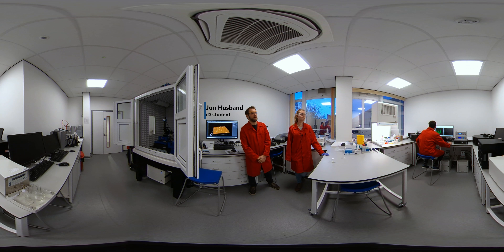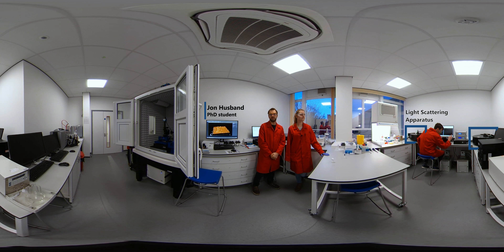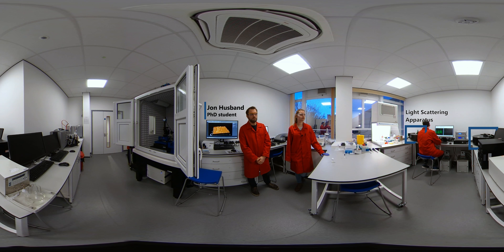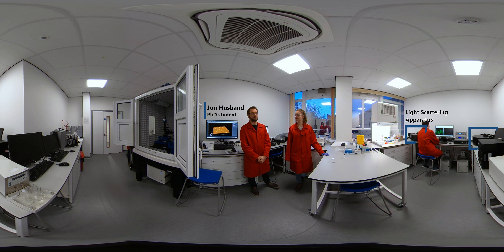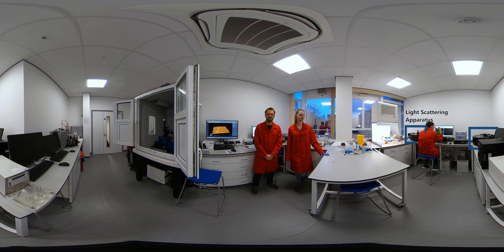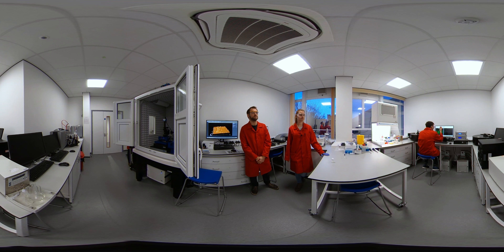Over there we have Zach, he's working on one of our light scattering instruments. These use lasers simply to tell us the size of the particles that we've made, and this is based on the fact that larger particles scatter more light than smaller particles.